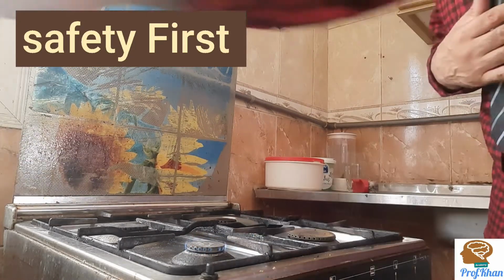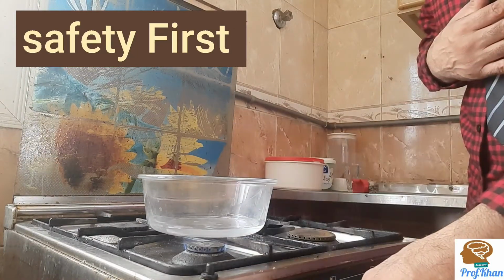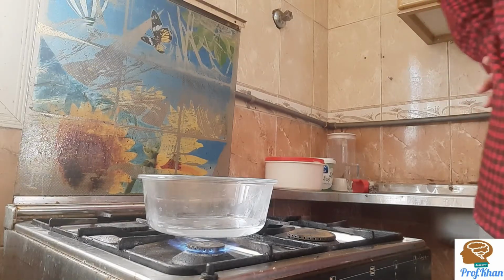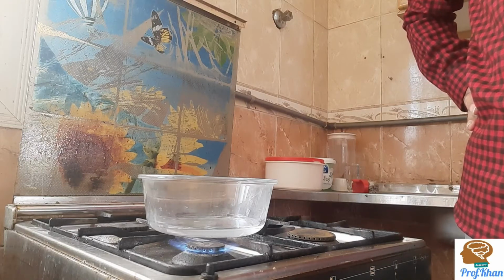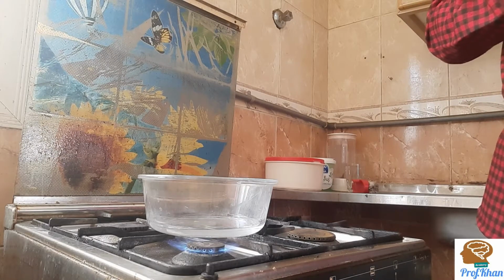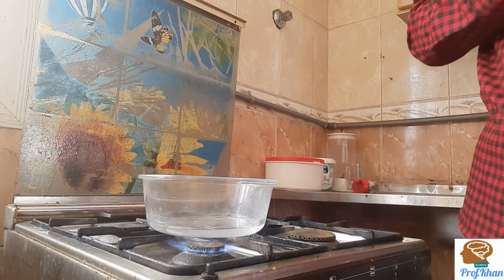Okay, now I'm going to place it over here, it will take some time, and then at the end we will have a salt, right? We need a little bit of concentration over there. It will take some time, you know that it is a slow process.